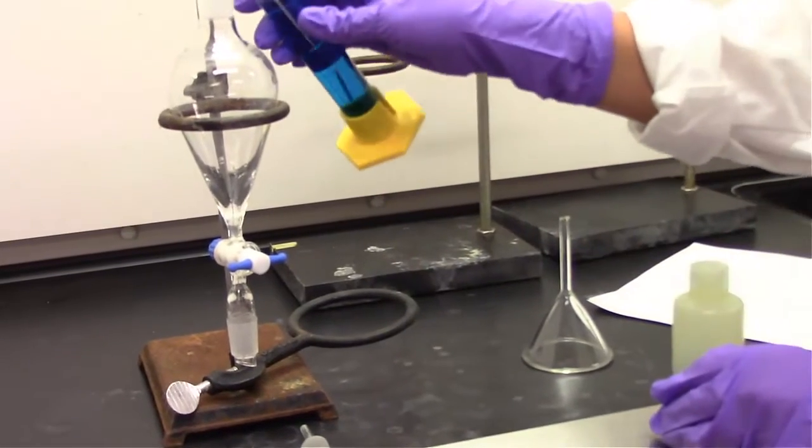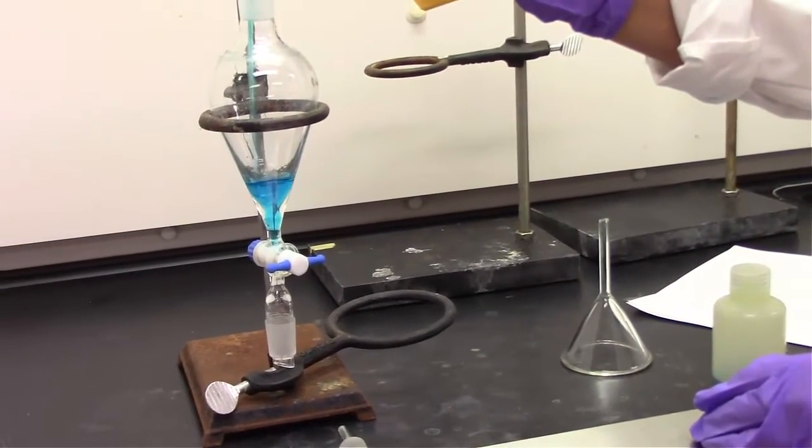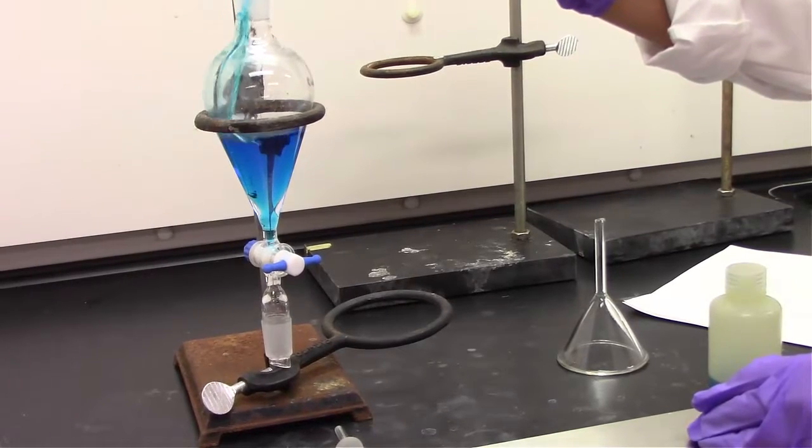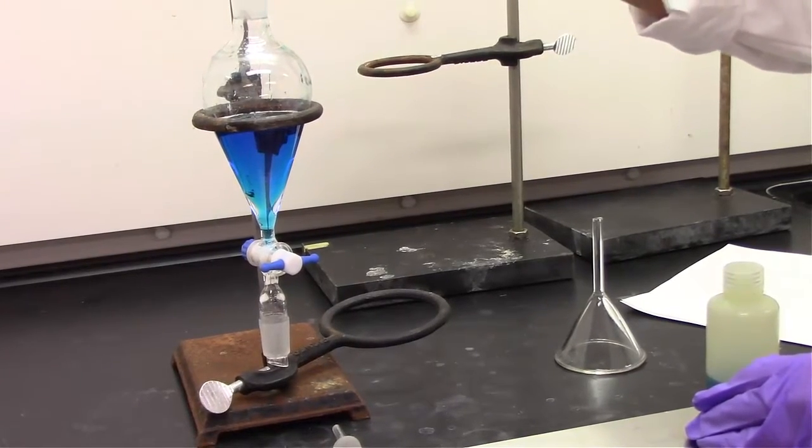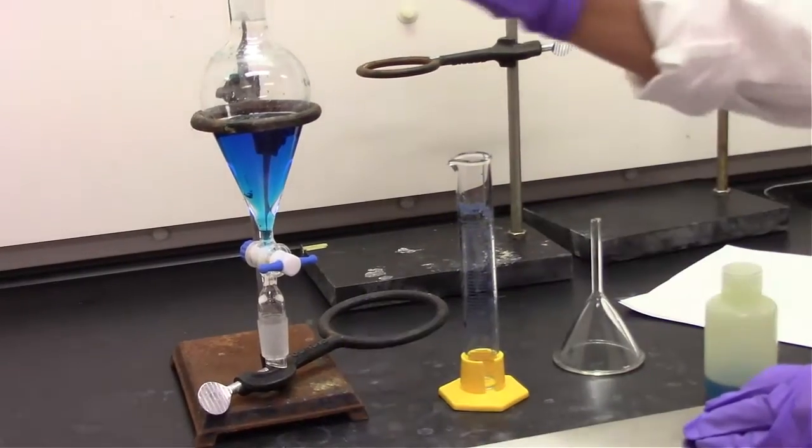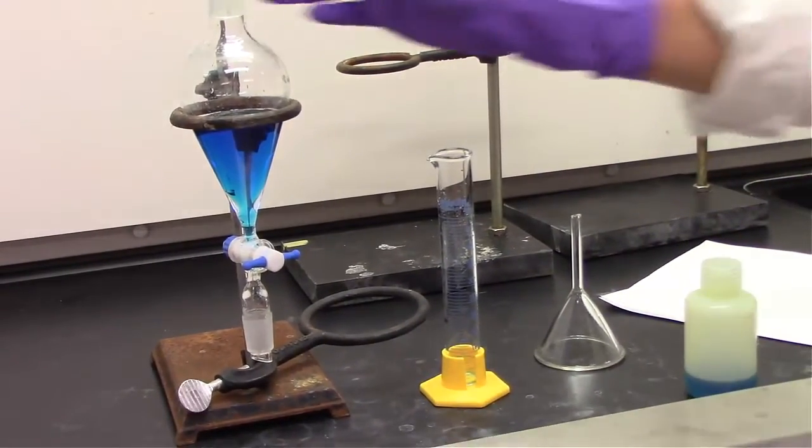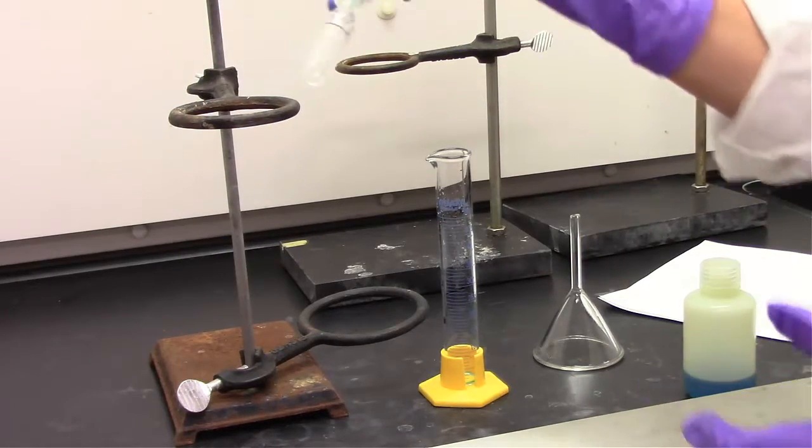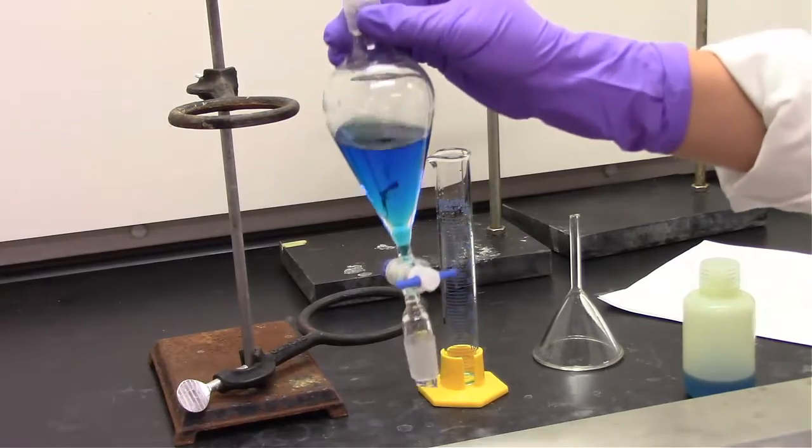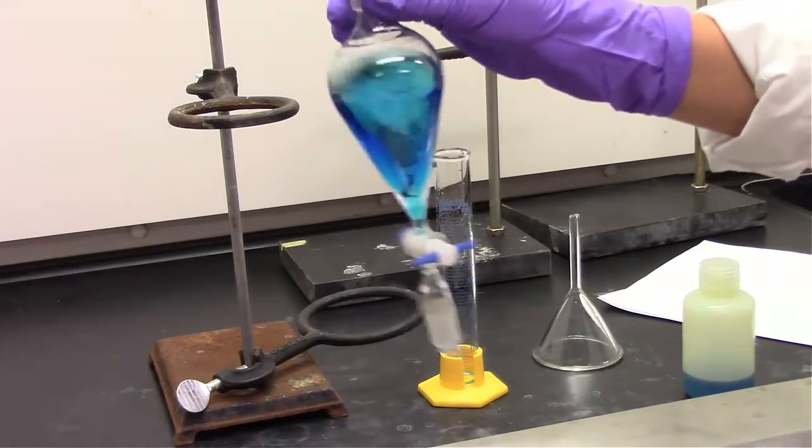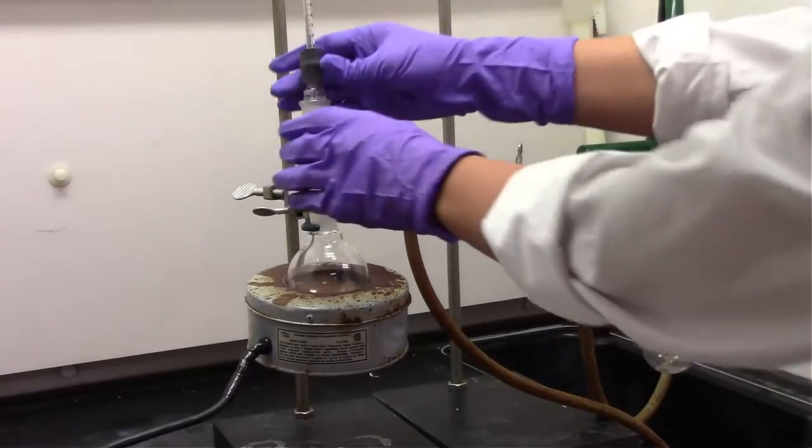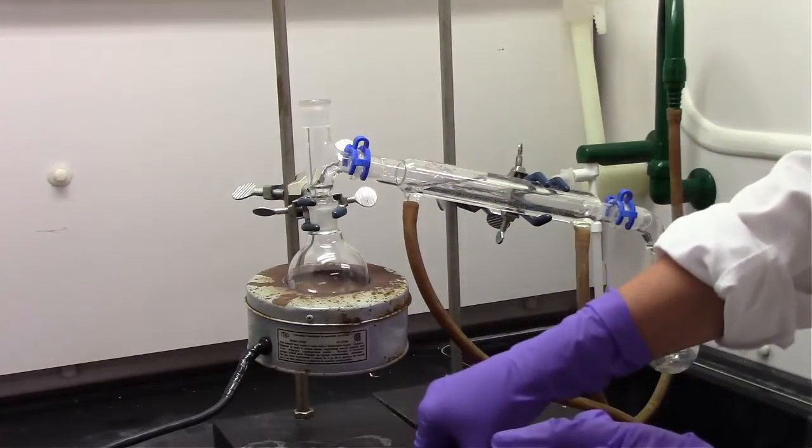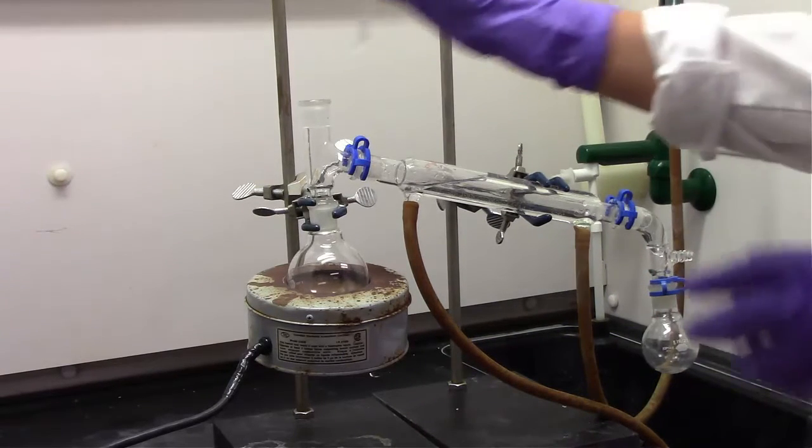So we're going to add about 48 milliliters or so into the separatory funnel. Now, with acetone and water, we've got an organic solvent and an aqueous solution. A lot of times, if we have enough of a carbon chain or enough of a non-polar area on that molecule, we'd separate it in two layers. So if this was hexanes and water, we'd actually see two layers in a separatory funnel. I do not see two layers in the separatory funnel. There's only one, and the reason why is because water and acetone are soluble or miscible within each other.